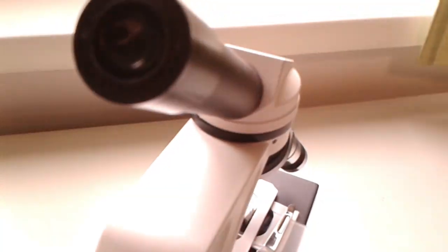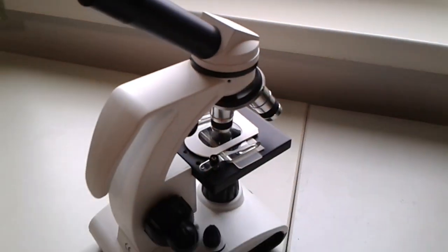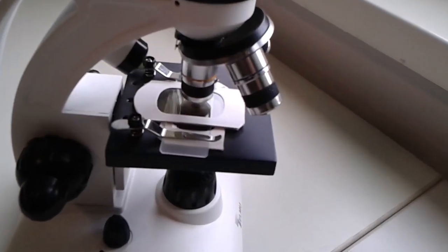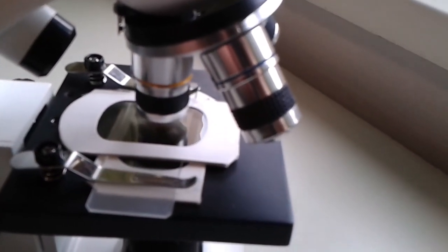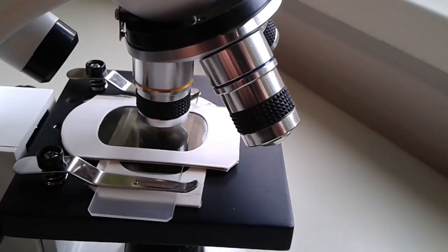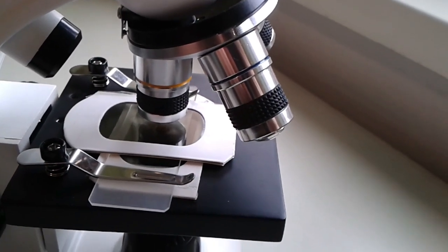And you do not need any expensive equipment, okay? So right now I'm filming directly through the eyepiece. This does not look quite as sharp because I'm using my mobile phone here. But this microscope is a very low cost one and you can also see that in this case I'm using now the cardboard 3D glasses.